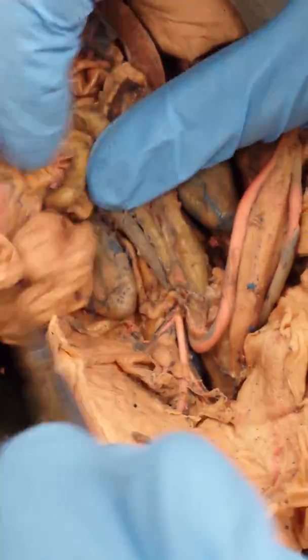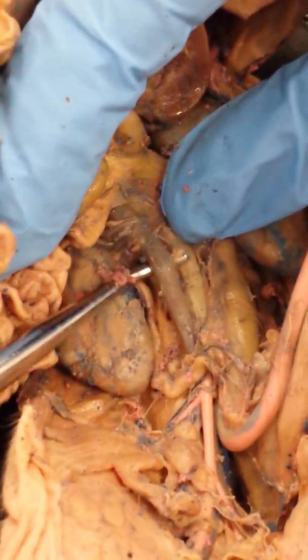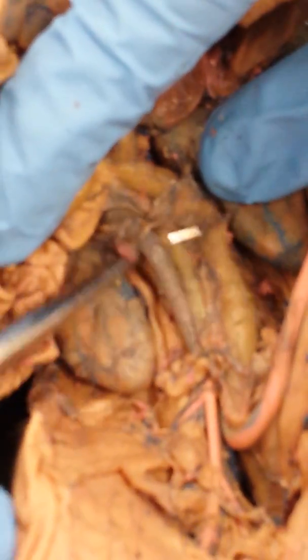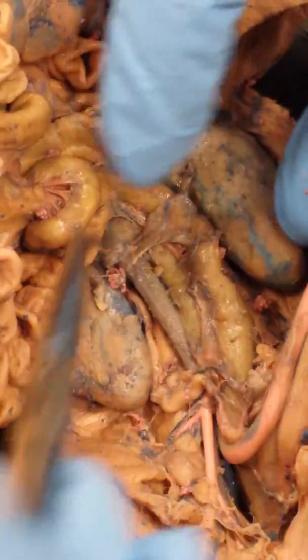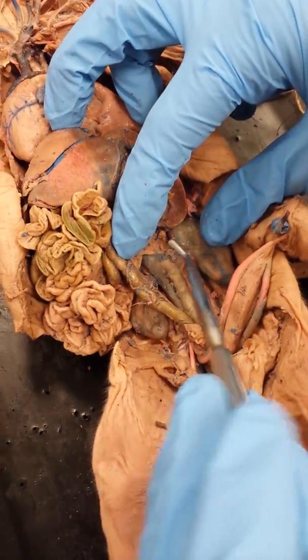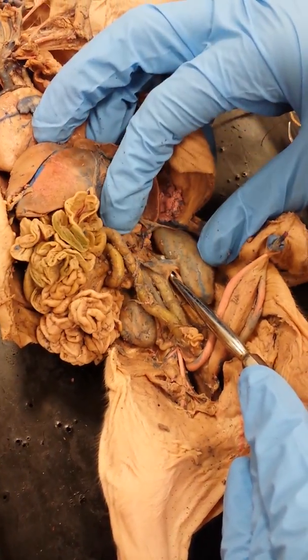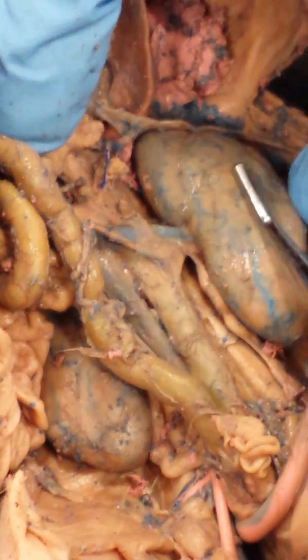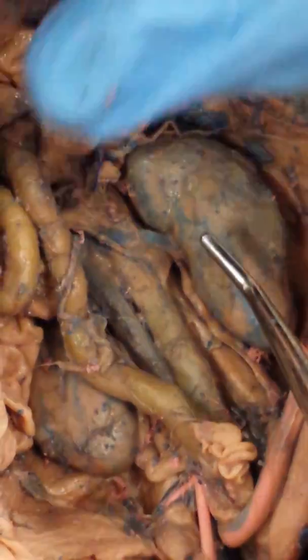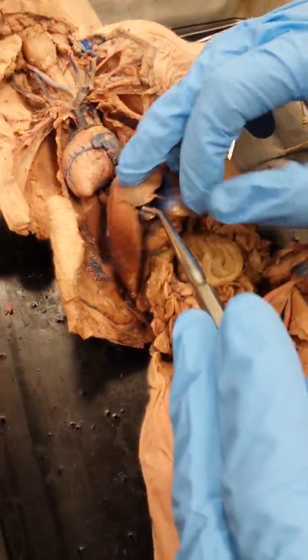Okay, we definitely see blue here. So there's your posterior vena cava. Let me put my probe underneath it. So there's posterior vena cava. Alright, the only two veins we're looking for here is not only the posterior vena cava, but the renal vein, the nice big blue vein, draining the kidney. And then the umbilical vein, which we actually cut when we opened the pig up. And there's a piece of it.